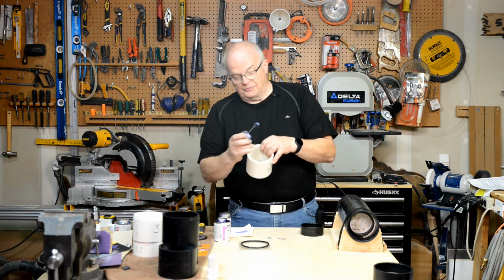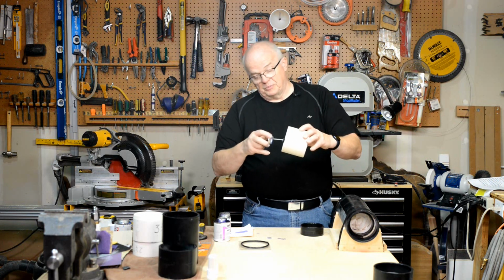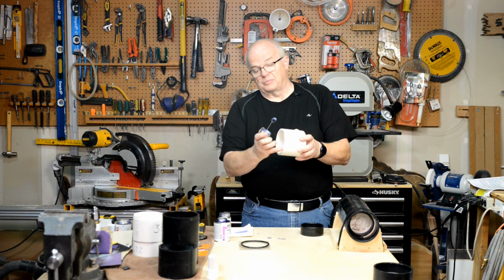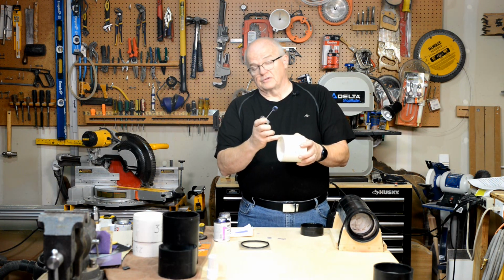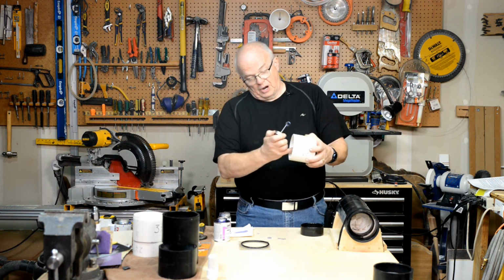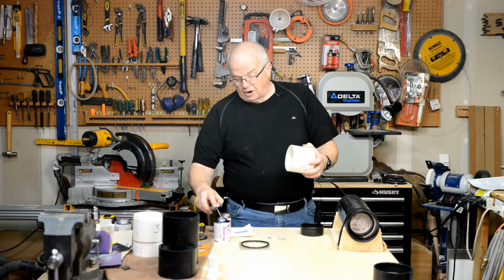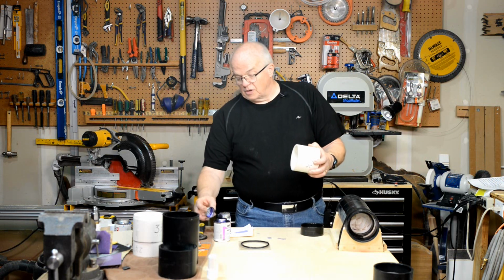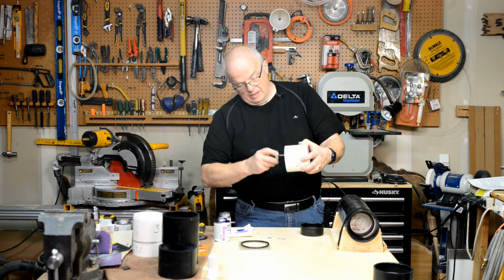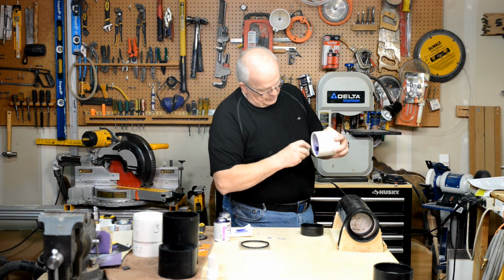Now on this piece, this is your smooth edge here. This is the edge that I sanded. I'm going to want to put the primer on the inside, but I'm not going to want to bring it all the way up to this edge. I don't want any primer on this smooth edge here, because like I say, that's the edge that your O-ring is going to sit up against. So I'll prime this back about maybe 1/4 of an inch, and then I will prime about an inch worth. Okay, here you can see it. Stay away from that edge as much as you can.